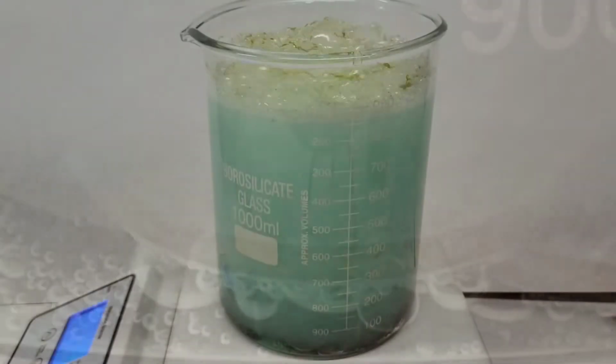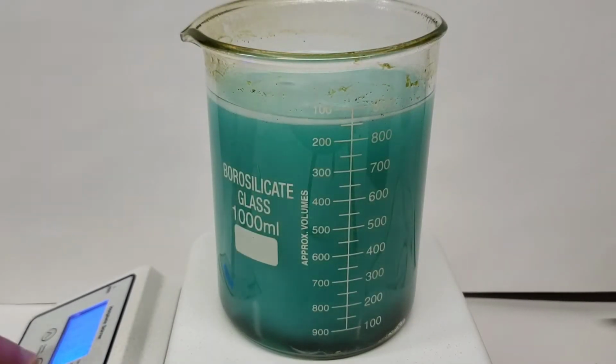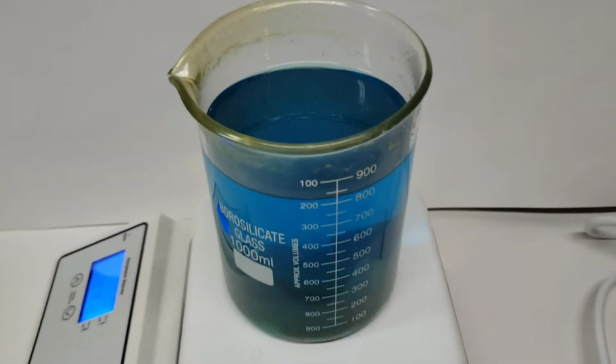Now here's a bit later, towards the end of the reaction. Here I turned up the heat just a little bit above boiling by accident, but you can see as it cools down, it gets a lot more transparent, and in my opinion, a lot more of a beautiful shade of blue-green. And really, I didn't realize this at first, but the solution is just absolutely gorgeous. You can see here all the bubbles and stuff rising through it. I just think it's super pretty. It's really cool. And I think it almost looks like stars in a galaxy or something like that, but of course, all in that signature copper bluish sort of color. Which, again, I think is just a beautiful color.